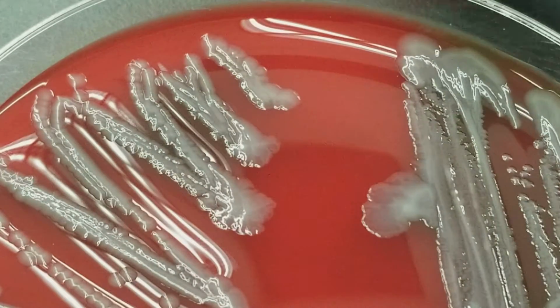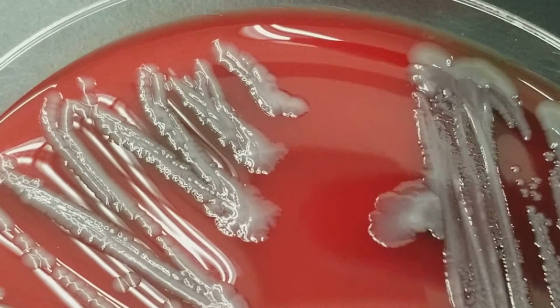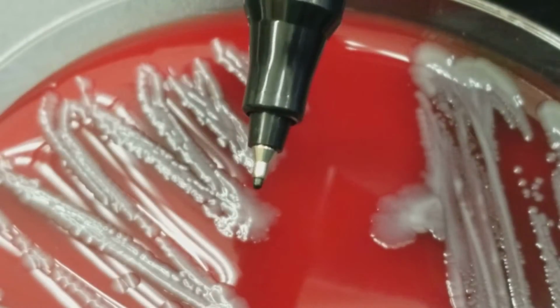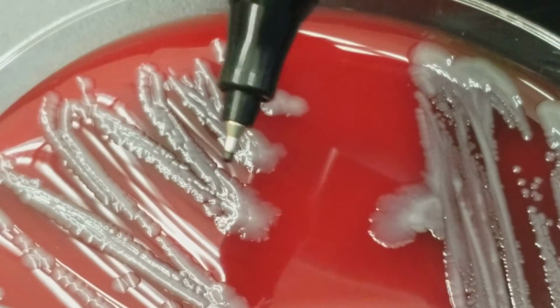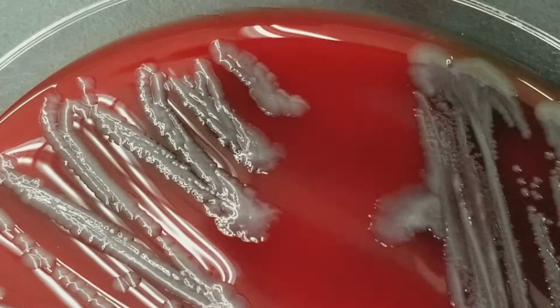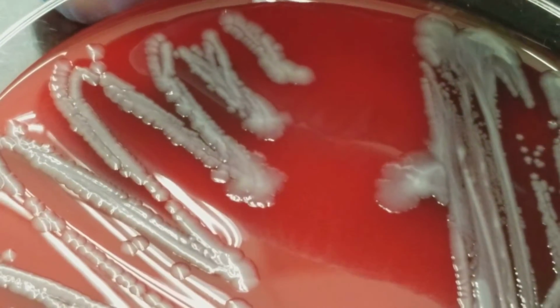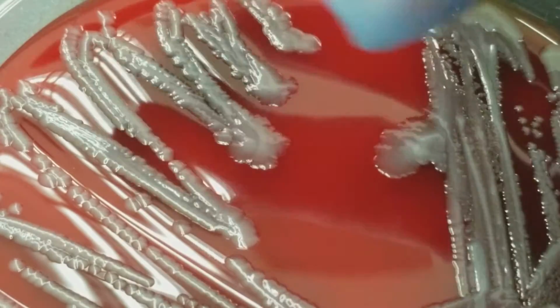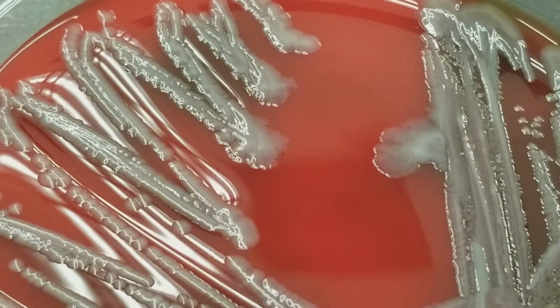Notice that it has kind of almost like an apron around these end parts of the lines, okay? It kind of fans out. That's very, very common with a GNR, okay? Your Enterobacteriaceae family ends up having that a lot. And the colonies look bigger because the rods are bigger usually than the cocci, okay? So you would expect larger colonies anyway, but that scalloped edge is very common with the GNRs.